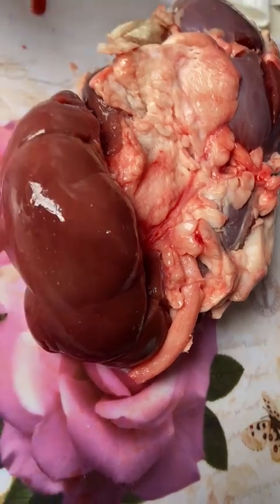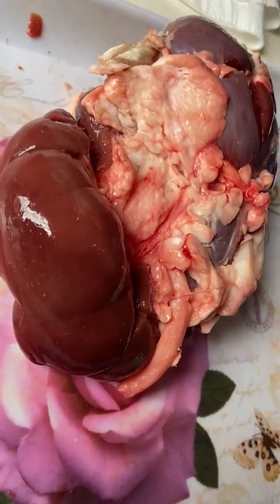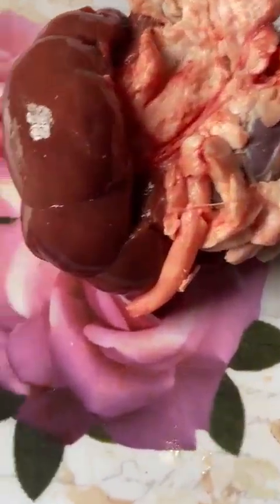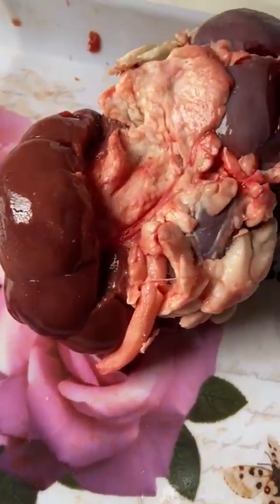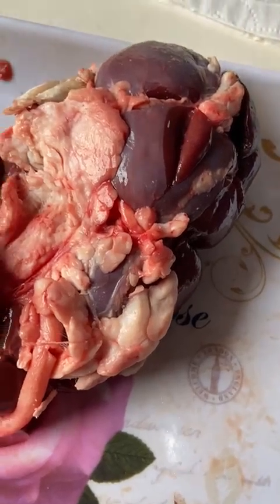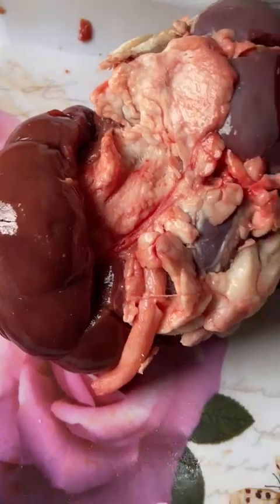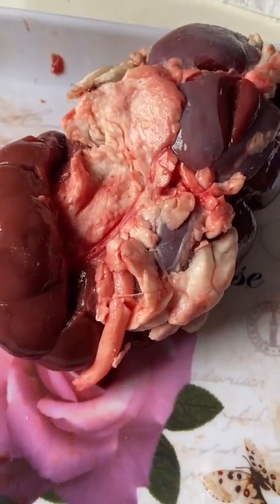In conclusion, this dissection has allowed me to observe both the external and the internal structures of the kidney lobes and understand how each part plays a role in filtration, urine formation, and excretion.